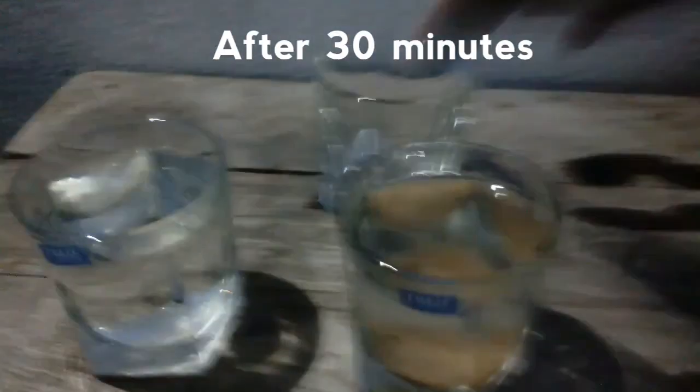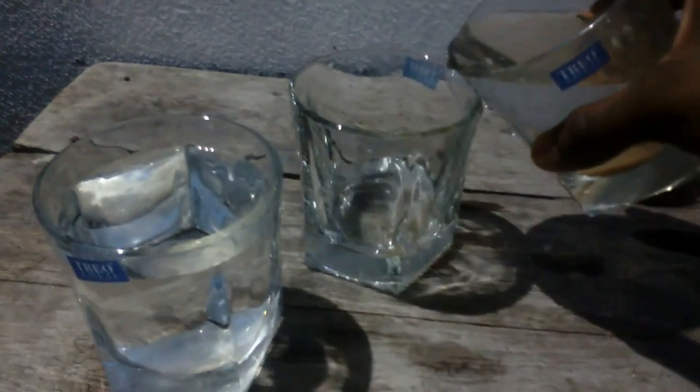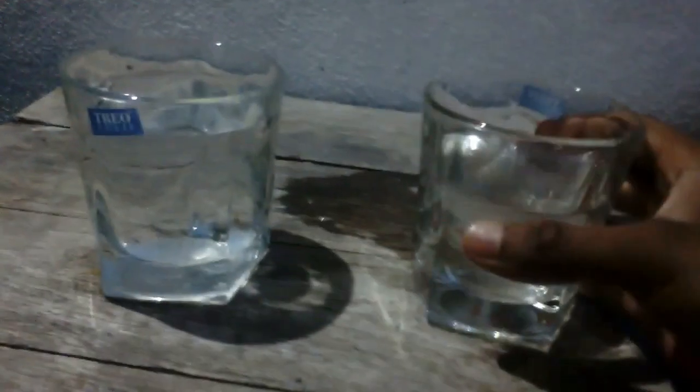Now I'm taking another glass and pouring this water into it. You can see the floc and mud particles have been left behind. This water has become pure, clear water — you can see it is clear.